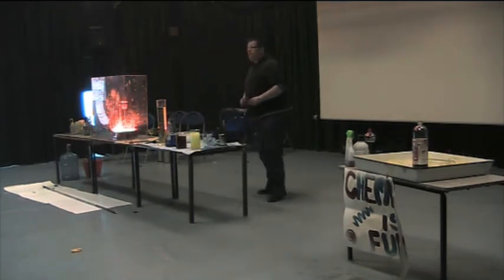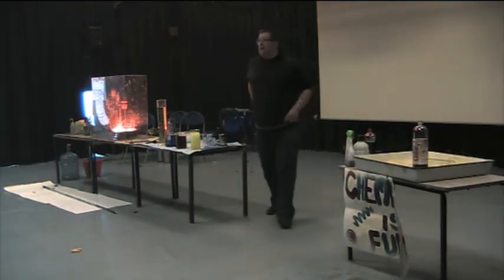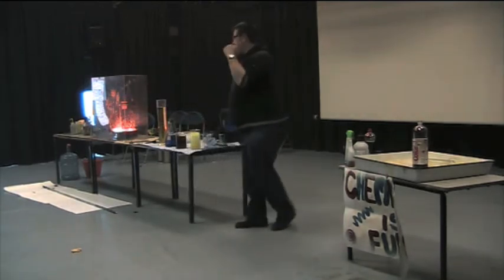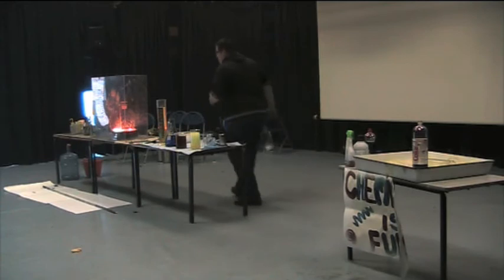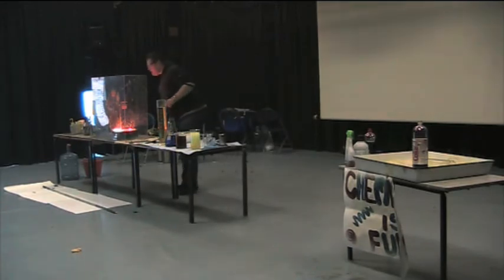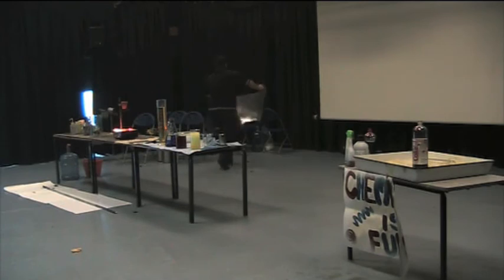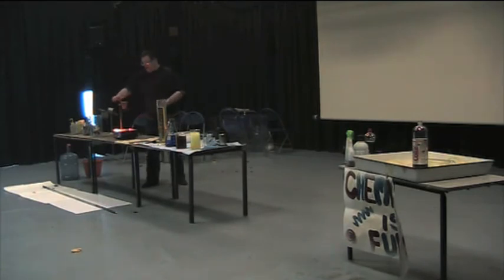Okay, hopefully, do you all see the iron pouring out the bottom? Yeah? 3,000 degrees of heat in the space of a few seconds. That's how powerful chemistry can actually be. It's really rather warm down here. Try and move this out of the way. So hopefully, can you all see the iron glowing in the bottom?